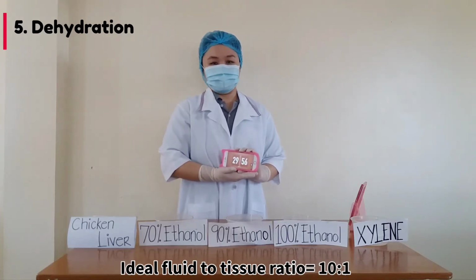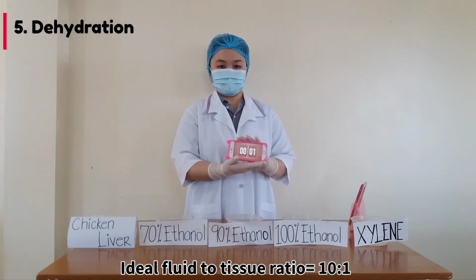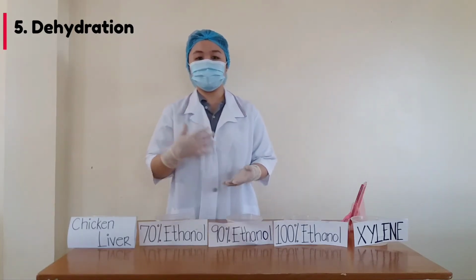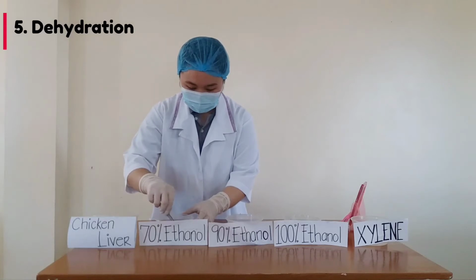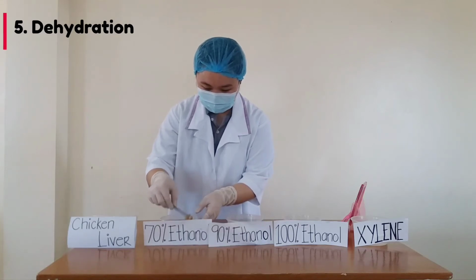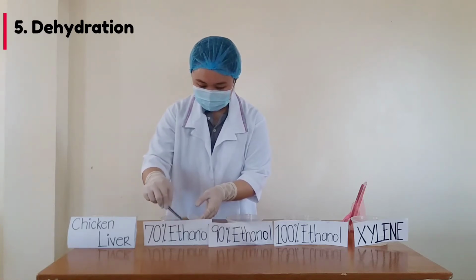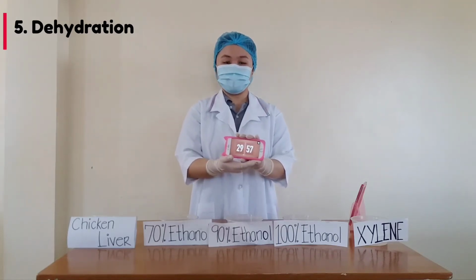And we will now wait for 30 minutes. Our 30 minutes is up, and now we will transfer our specimen into a higher concentration, which is the 90% ethanol, for another 30 minutes. Our timer starts now.